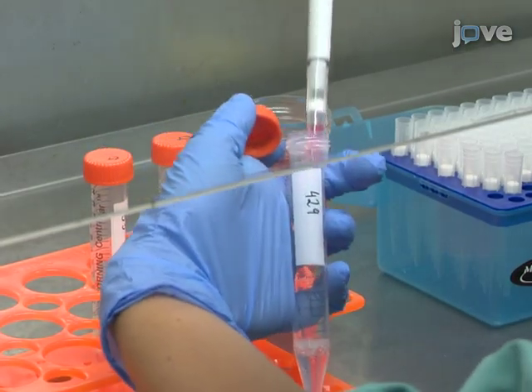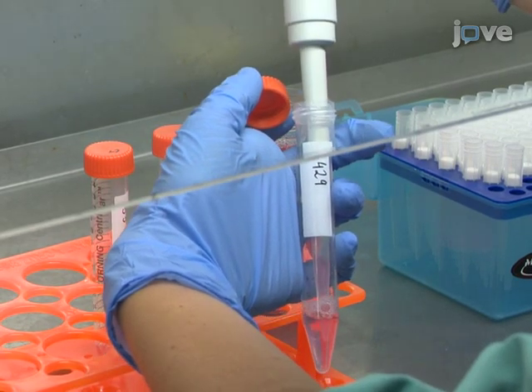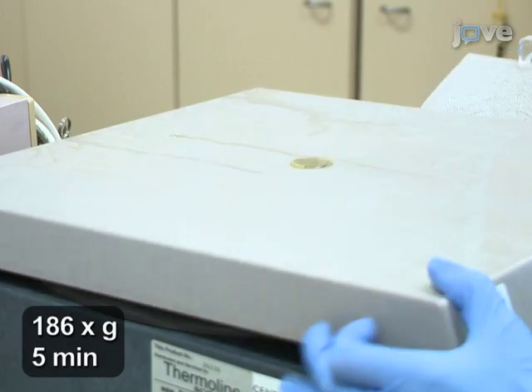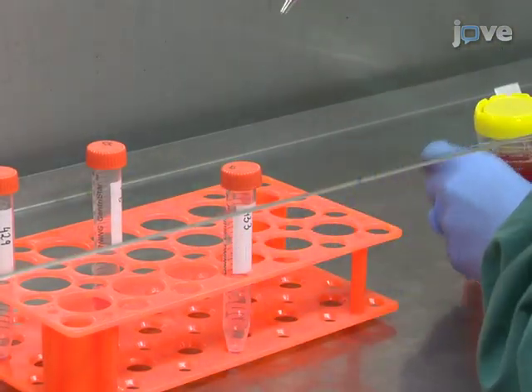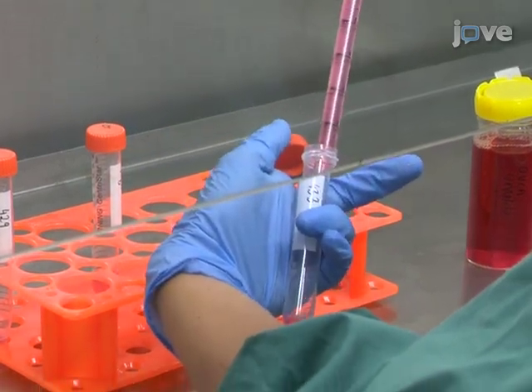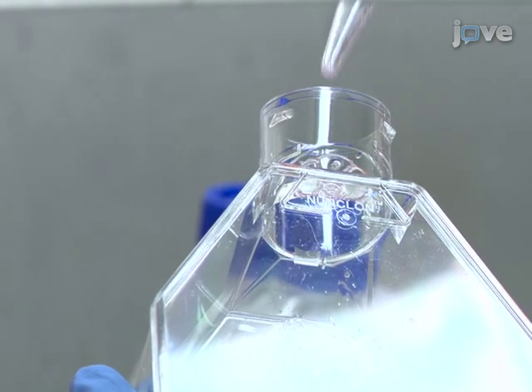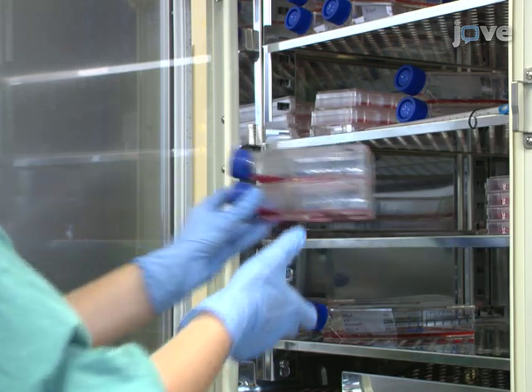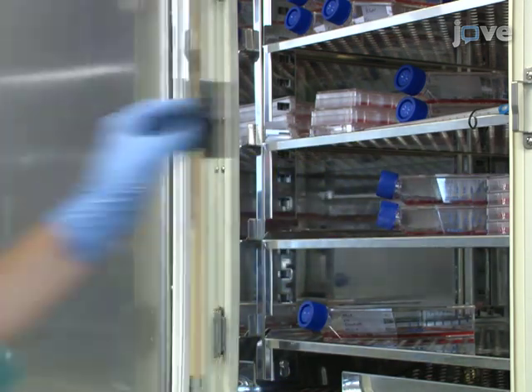Quench the reaction with 1 milliliter of ice-cold medium containing 10% FBS and re-pellet by centrifugation. Re-suspend in 10 milliliters of the appropriate pre-warmed growth medium and seed cells into a 75 square centimeter filter-capped flask. Culture at 37°C, 5% CO₂ until the level of fluorescence labeling is adequate for detection.